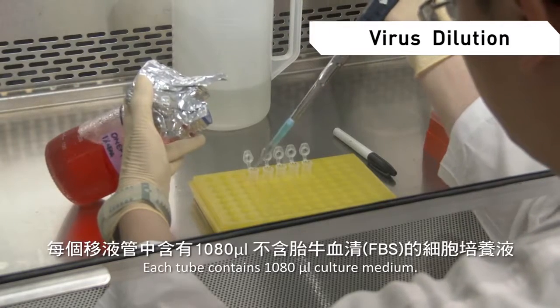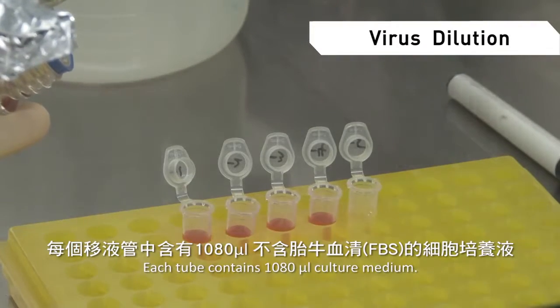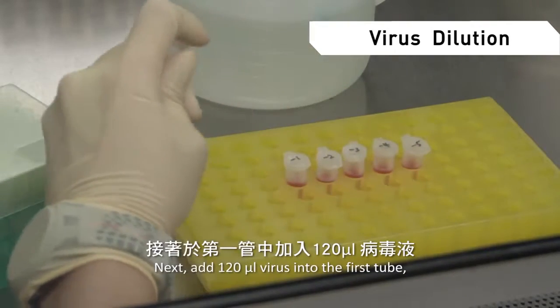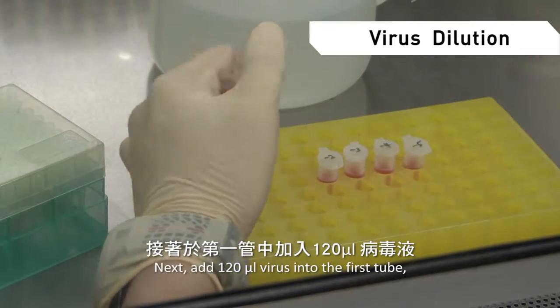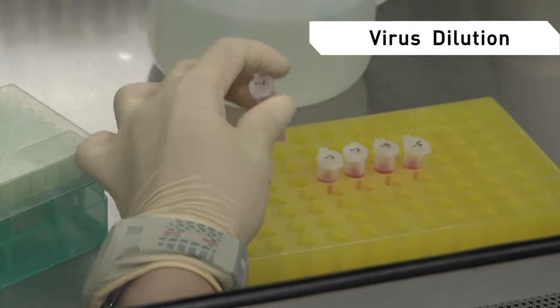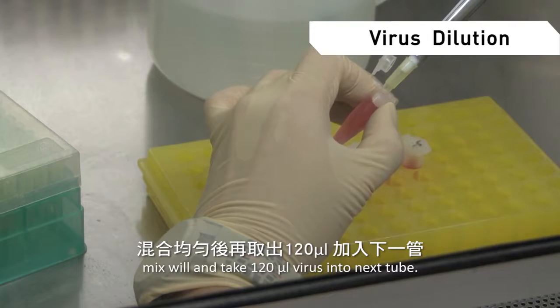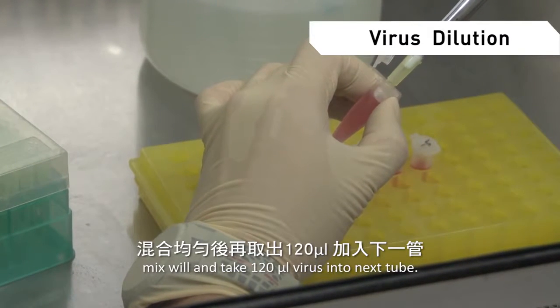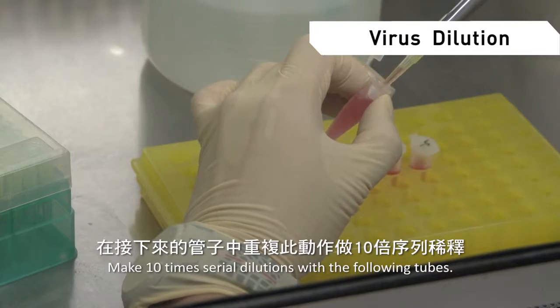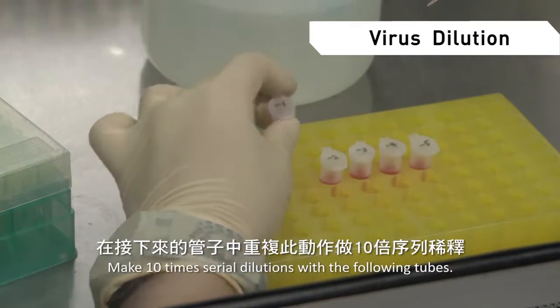Each tube contains 1080 microliters of culture medium without FBS. Next, add 120 microliters of virus into the first tube. Mix well and take 120 microliters of the dilution into the next tube. Make 10-fold serial dilutions with the following tubes.